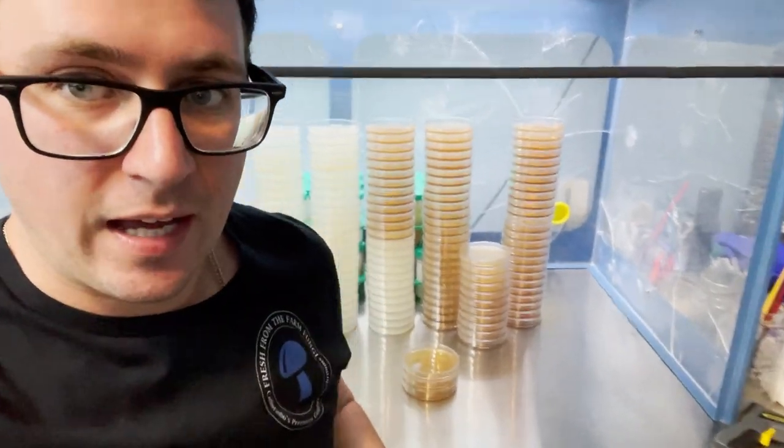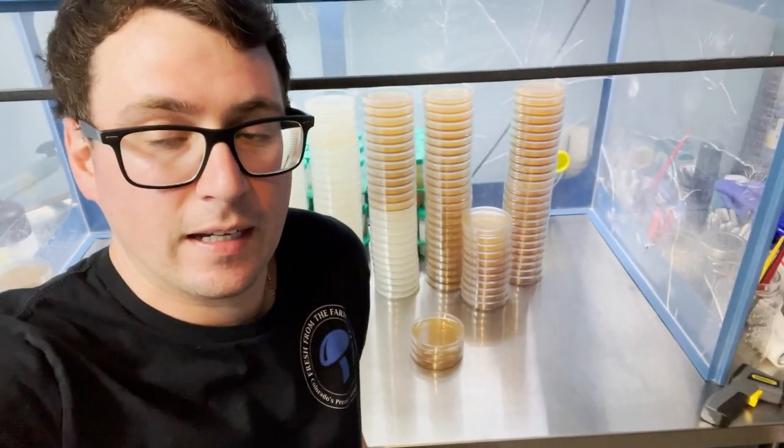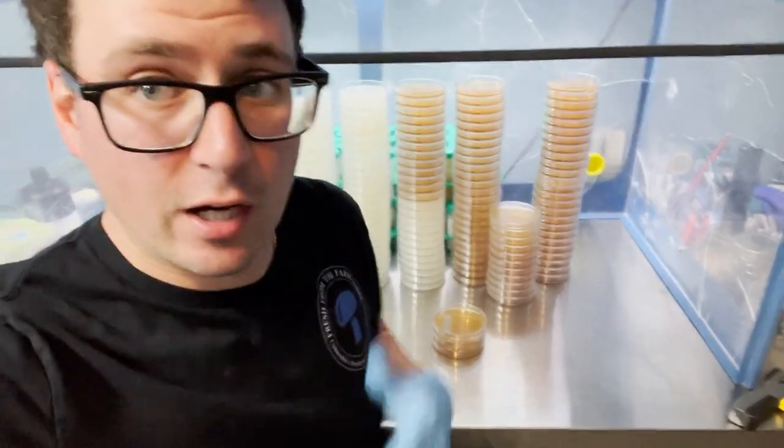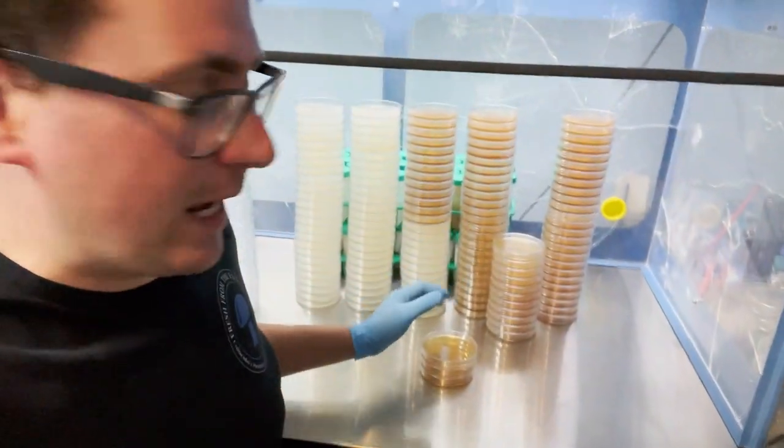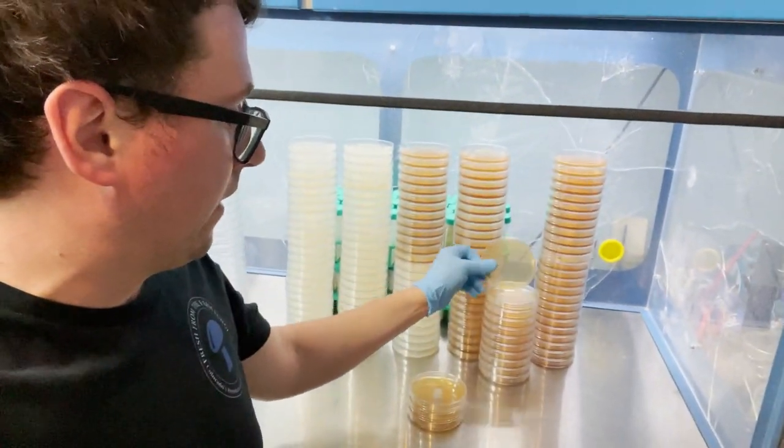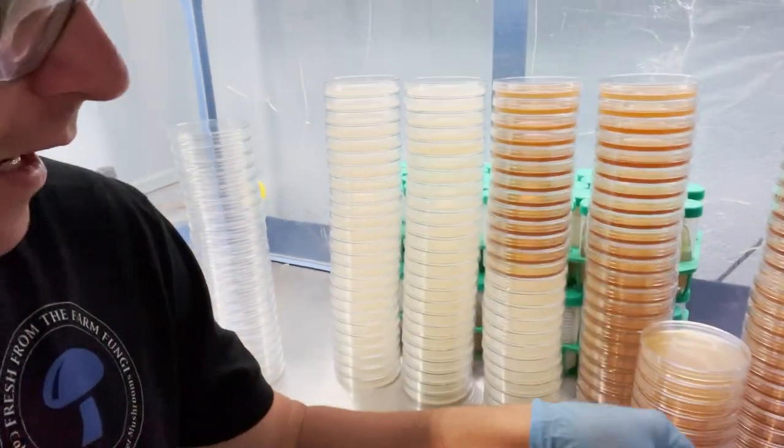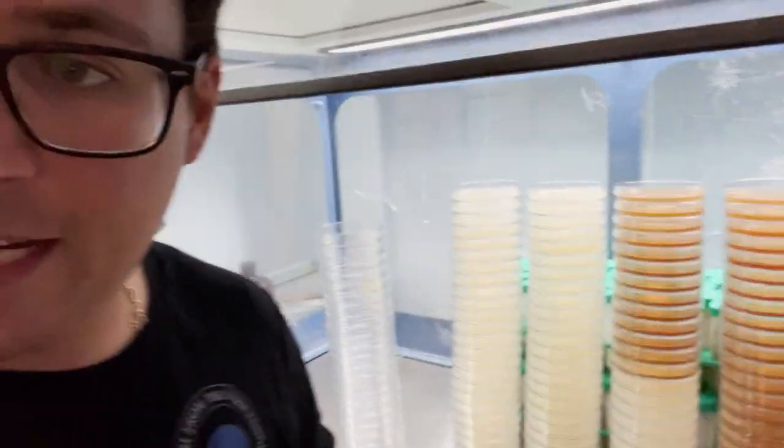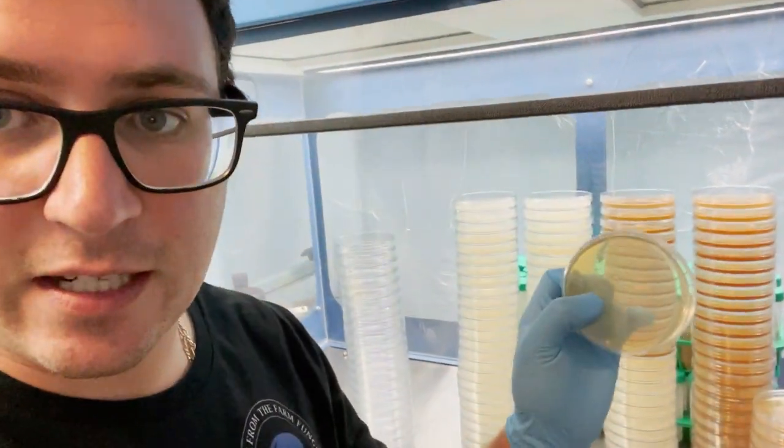What's up guys? So it's been about four days now and I just let these plates all sit in my flow hood over the weekend. And now I'm just going to go through them and double check that there's no contamination. So you can see how nice and clear these are, just by letting them sit at room temperature a few days before I use them. Gives them that nice clear.